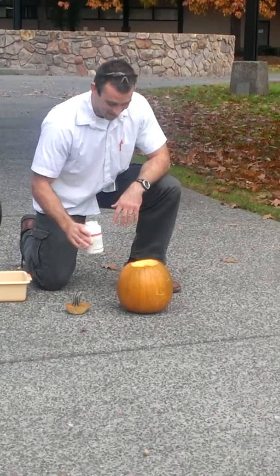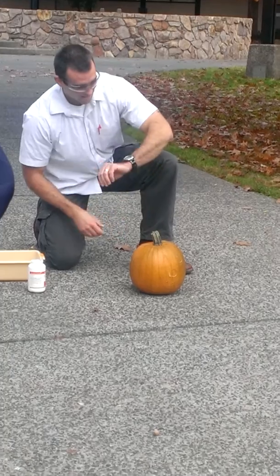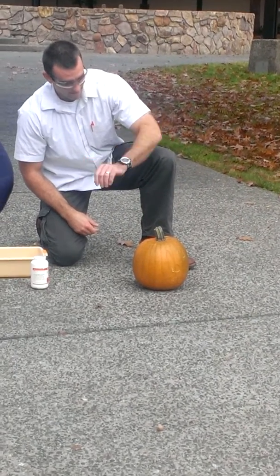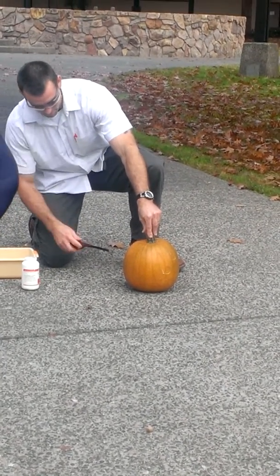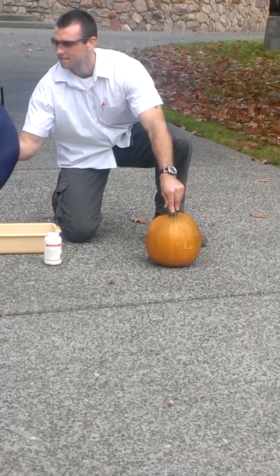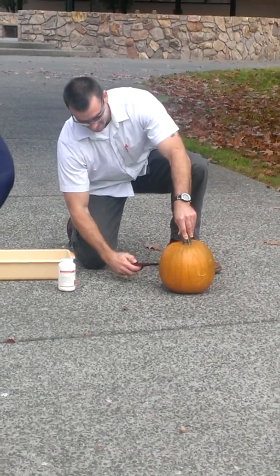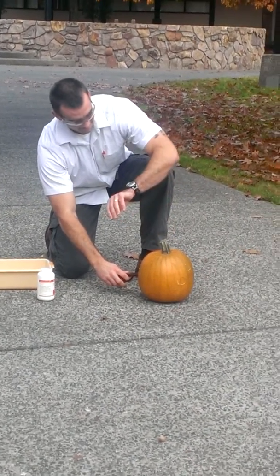No! Oh god, that's probably way too much. Okay, so let's see, we'll give it a good amount of time so that pumpkin juice covers me everywhere. I hope this thing works. I can't see the flame anyway. Well, pray for me, everyone.